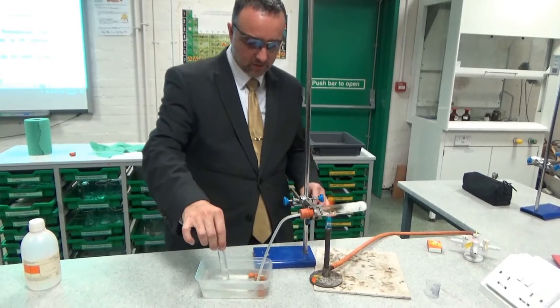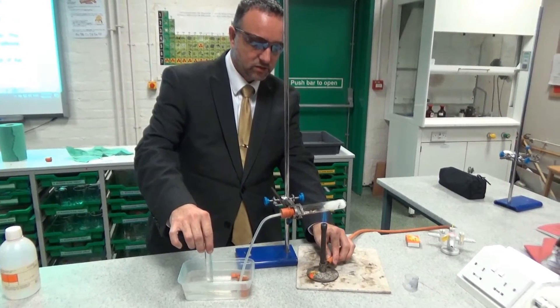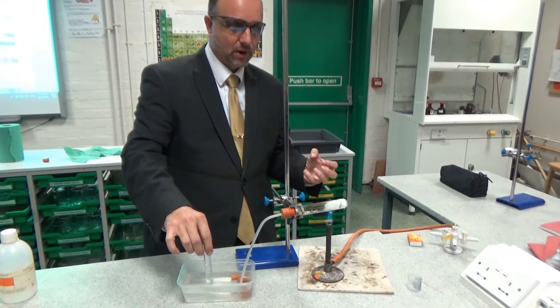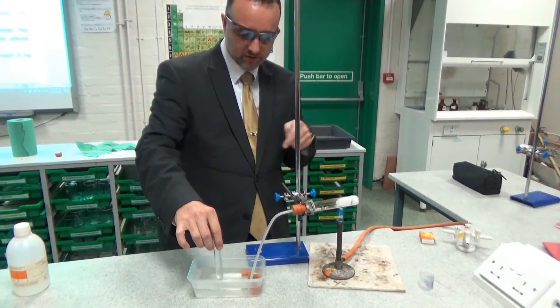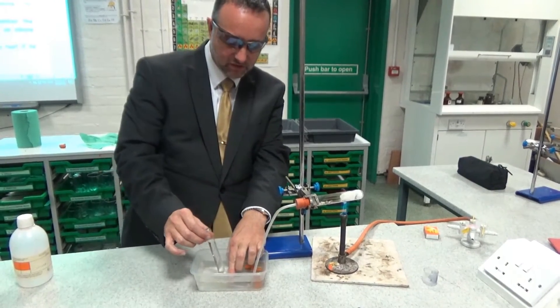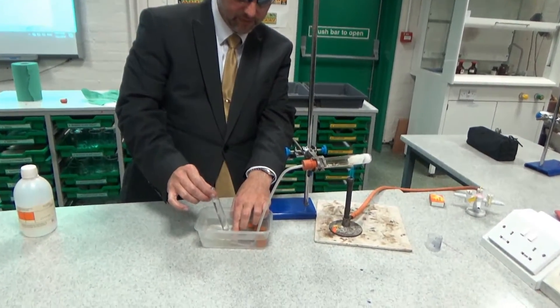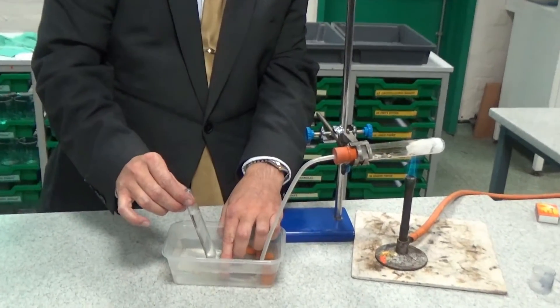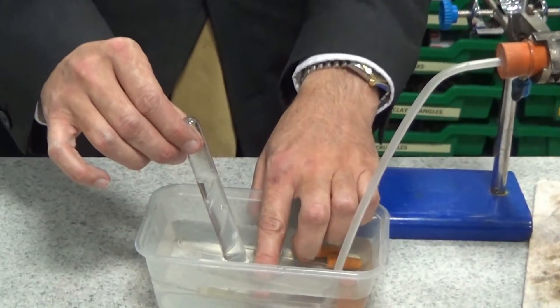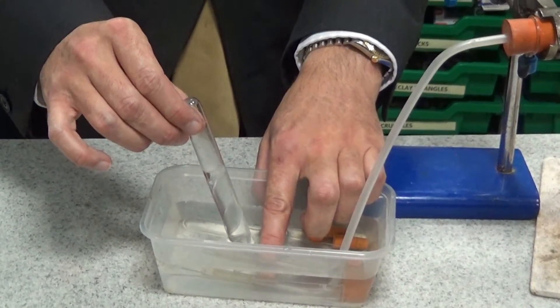Okay guys, so now we've actually got that really hot, we're going to take this over towards the paraffin, and that will heat and evaporate the paraffin. The paraffin then will go across the catalyst and hopefully that will be cracked. And you can see straight away that's collecting here. The hotter it gets, the faster it will collect. The vapours are passing over it and they're being cracked.